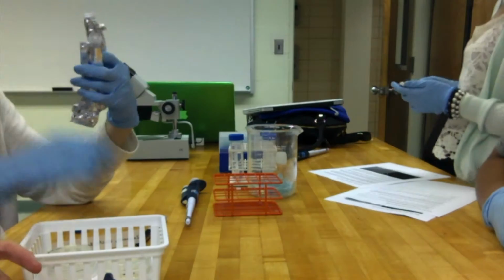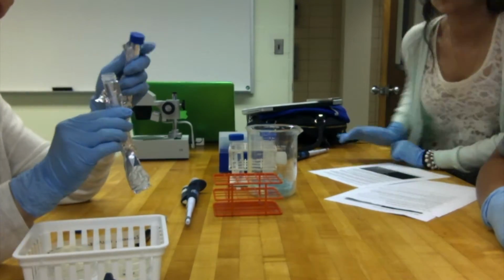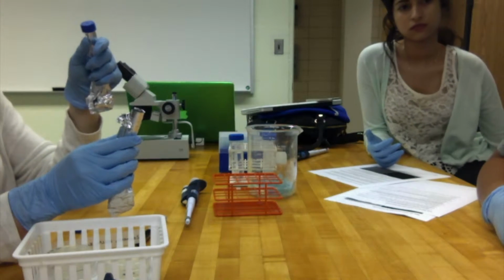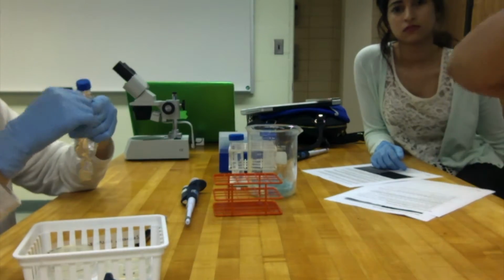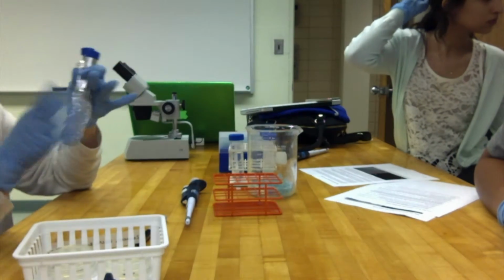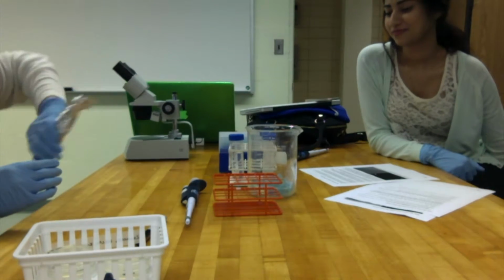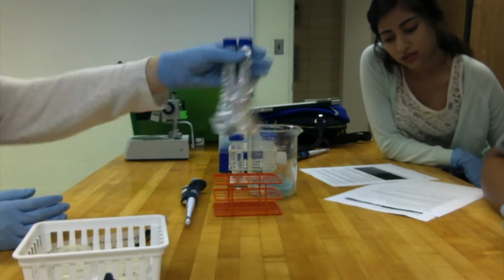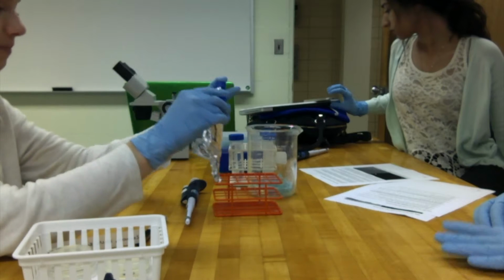Then the tubes were spun for 2 minutes again at 2,000 revolutions per minute. Excess M9 was removed until 0.1 milliliters was left in the tube. The worms were washed 3 times with M9 buffer, and after the washes, excess M9 was removed to a volume of approximately 100 microliters. The dye-filled worms were resuspended into the 100 microliter solution, pipetted onto a new plate, and destained for 30 to 60 minutes.